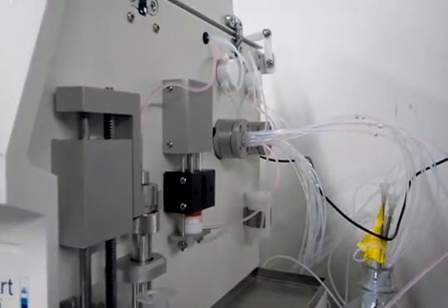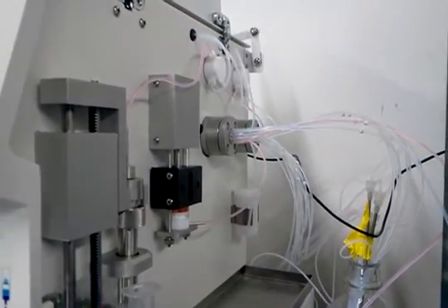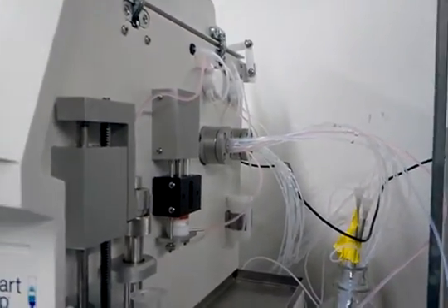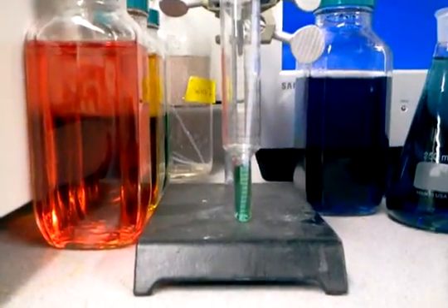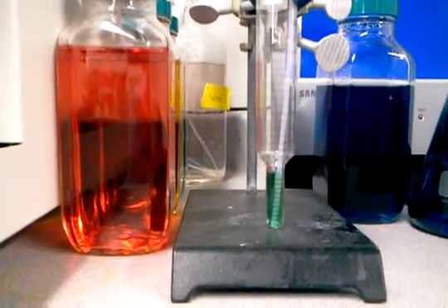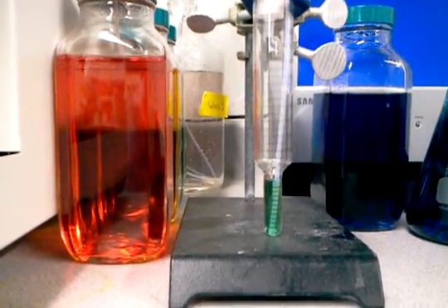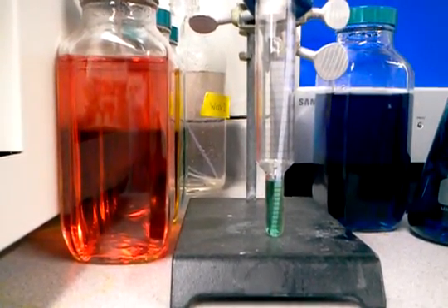This line will stay filled with the red liquid, and what the unit will then do is pull one mil of sample which I have in this KD vessel. The liquid volume is over one mil because of the tube that's inserted into it.